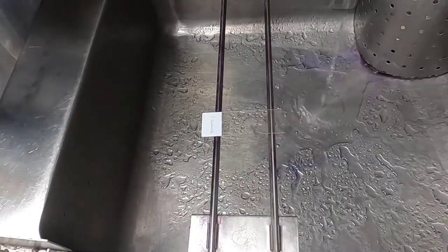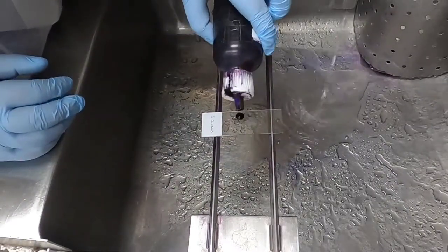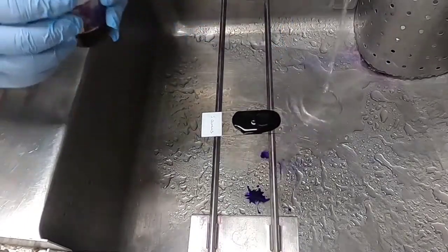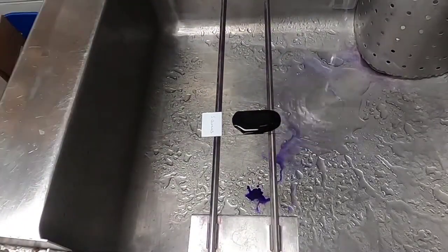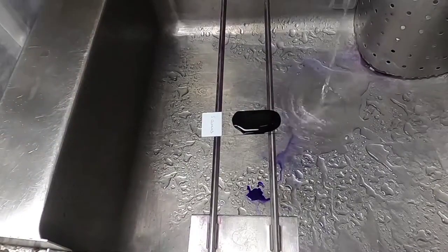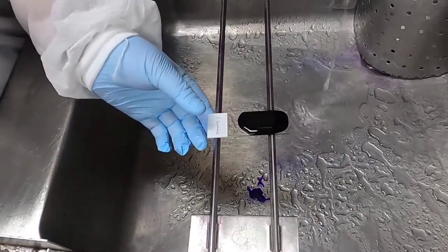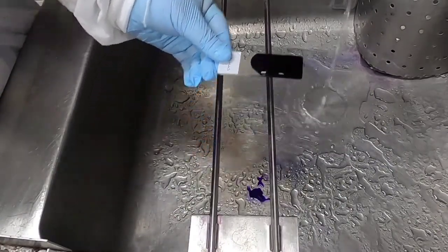Now you are ready for staining. We start with crystal violet — flood the slide with the stain and let it incubate at room temperature for one minute. Crystal violet is a stain that will stain absolutely everything, so it is a really good idea to wear gloves and be careful not to get any stain on your clothes.